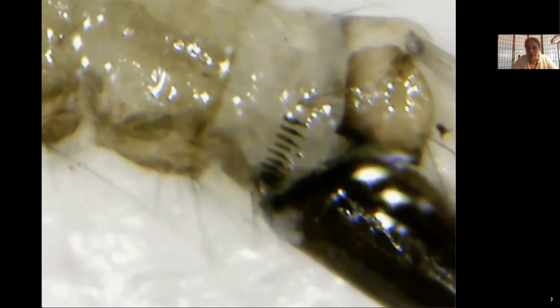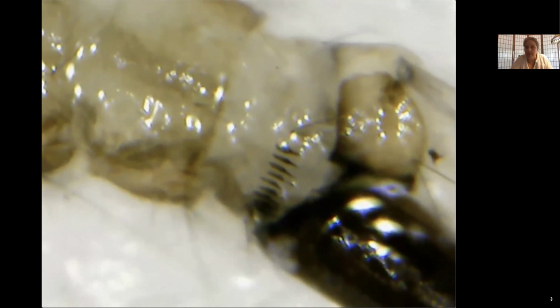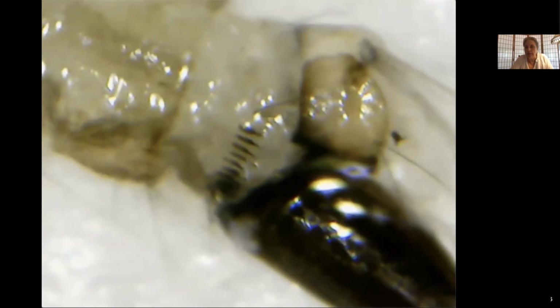Okay, so we have now focused in a little bit, and I'll just tell you, I'm having a little bit of trouble finding the pecten. One of the reasons is that this is a very, very dark siphon. And usually we will be able to see it because it will refract light a little bit differently. If you can get it to lay on its side, you can see it as a small row of almost regular teeth-like structures.